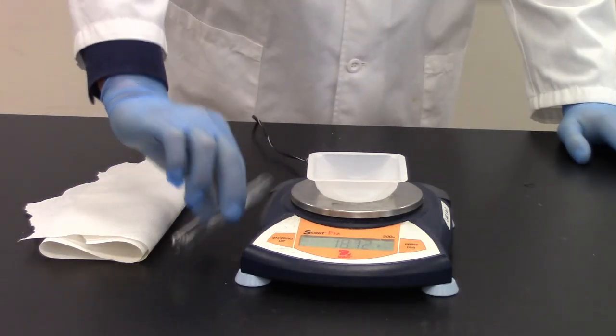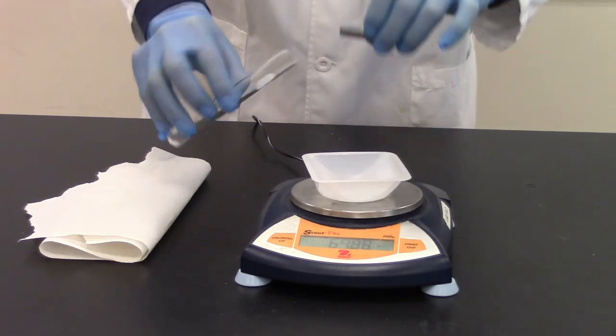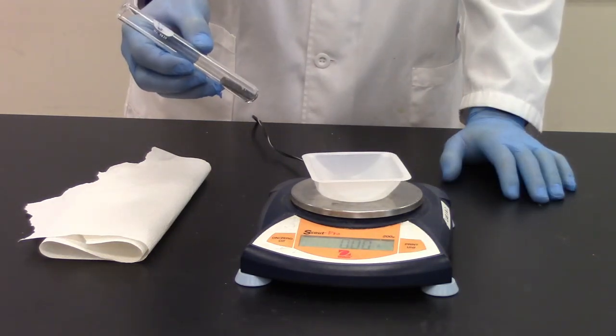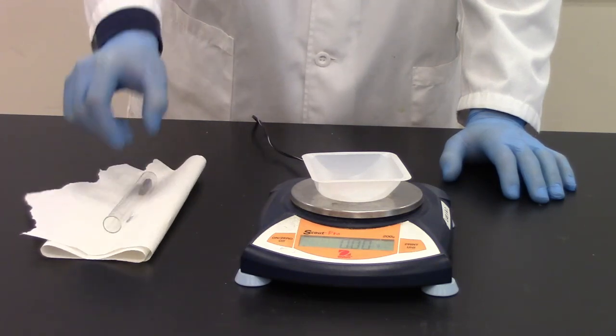I'm then going to take my test tube here and place the metal into the test tube so it's at the bottom. Just like that. And I'm going to set that aside for right now.